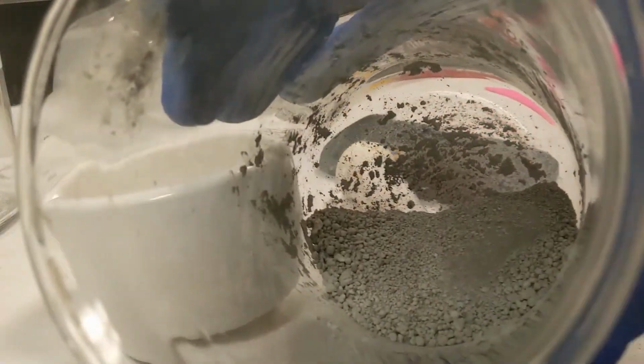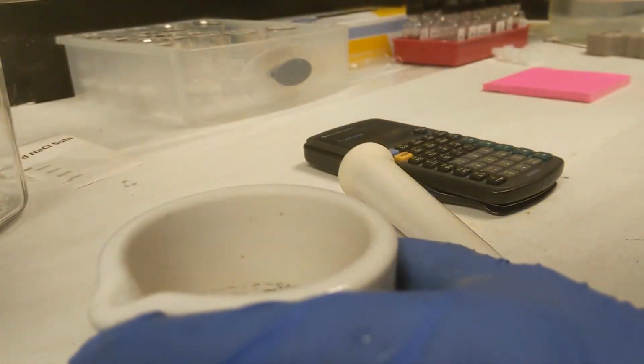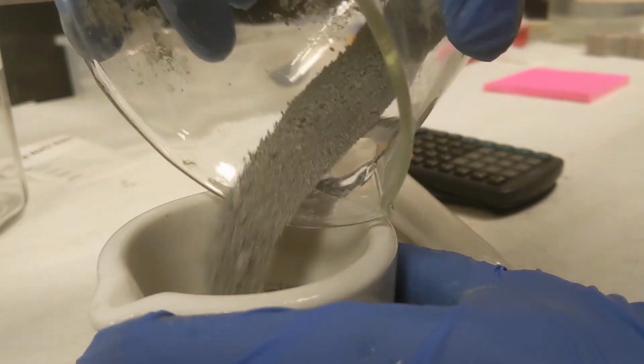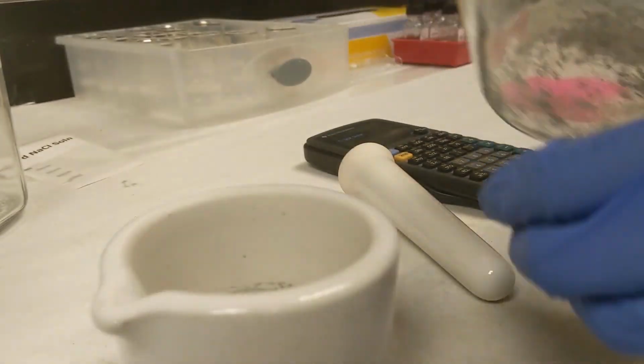So here's my B list. It's got basically little black particles, which I think is just probably silver oxide and copper oxide. I'm sure there's little bits of copper in here. I'm just gonna say, well, sterling silver has copper anyway, and I'm just gonna accept having a bit of impurity in it. I don't think there's any other choice for me. And if I see any copper, of course, any larger chunks, I'll obviously take them out.